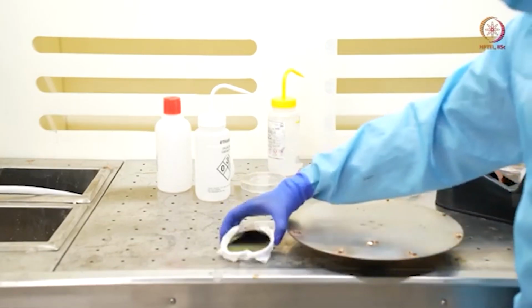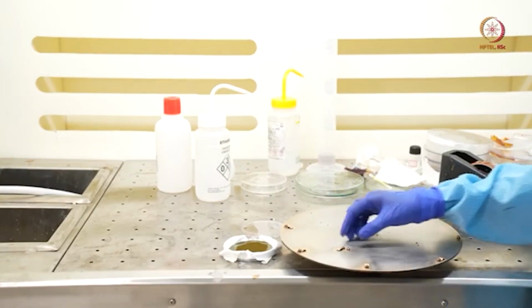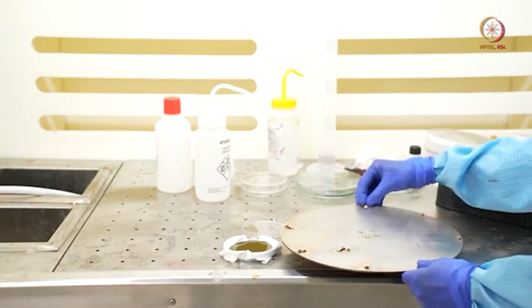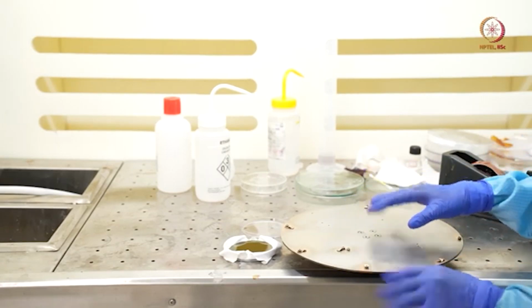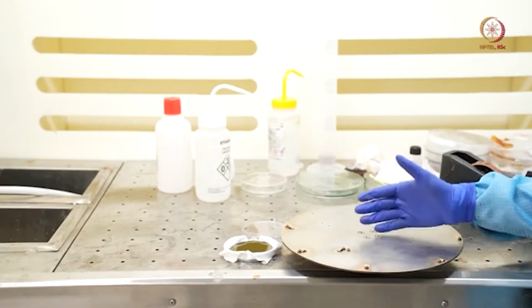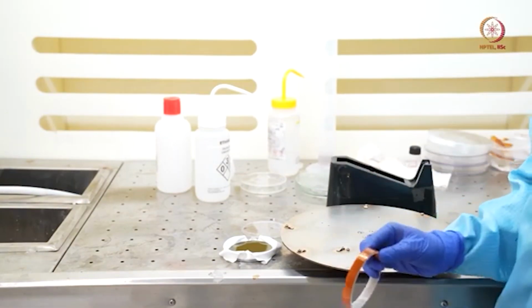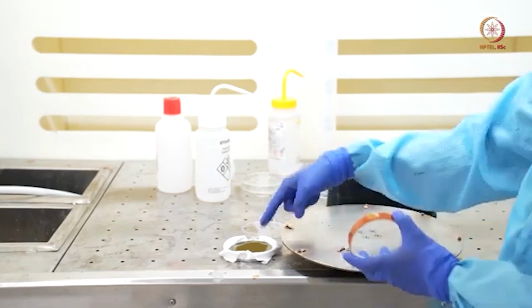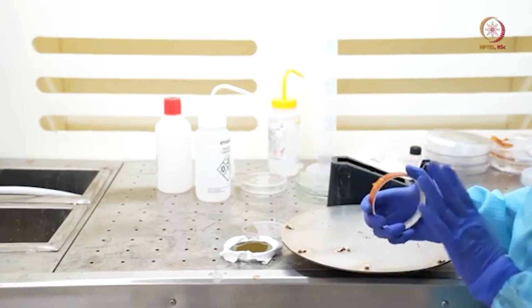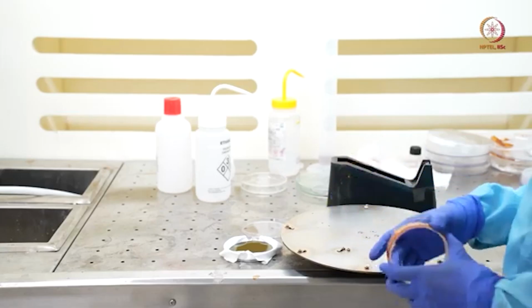For loading the sample, there are multiple ways of loading the sample on the chuck. You can see here the clamps. If you have a standard 4-inch wafer, then it is very easy to load using these clamps. And here we have 3 inches; though the clamp can fit it, we usually prefer using Kapton tapes. You can see this is the Kapton tape. Basically this is a polyimide material. The same polyimide material that is here, it is similar, but the thickness will be different, and this is commercially available. So we prefer to use polyimide tapes or Kapton tapes.